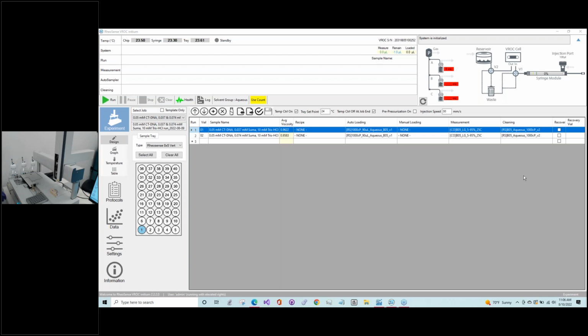The next thing I usually check is my reagent bottles over here. I always check to make sure that they're full and that they're properly connected. And if they're not full, I will usually take them off. The way I usually take them off is I release the gas first, like this, to make sure there's no gas left in the line. Oh, I don't know if you guys can hear that, but there's a little gas left. So you wanna wait for all the gas to be released.